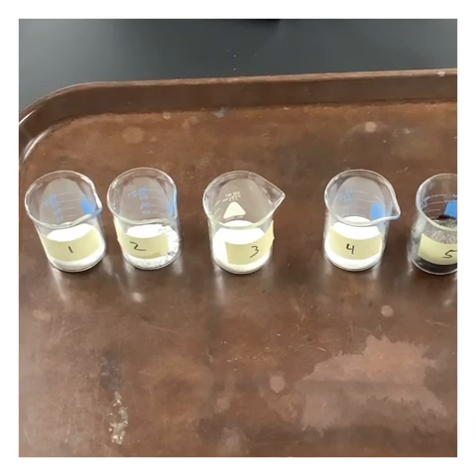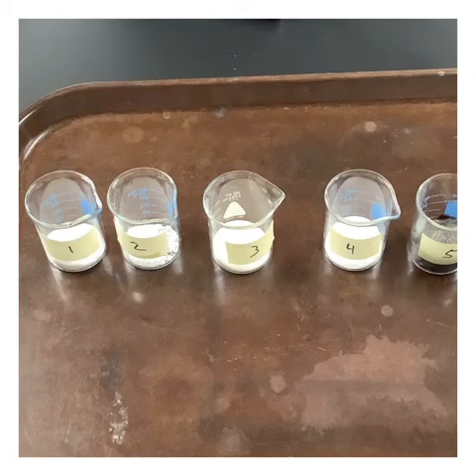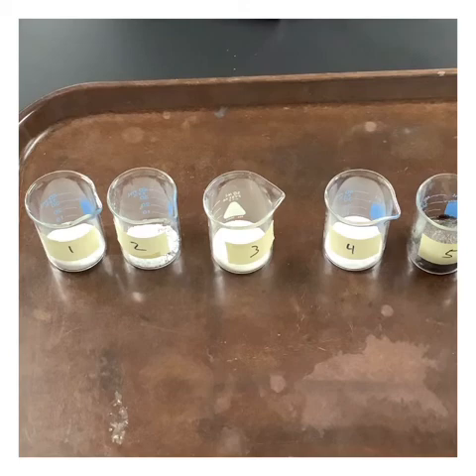Properties of bonding lab. Today we are going to be looking at 5 different substances and trying to determine the types of bonds that each one of these things has. In order to do this, we're going to be looking at things like conductivity and melting point to help us determine it. You can also use some sort of visual cues as well, but that's not the only thing that we're going to be looking at.